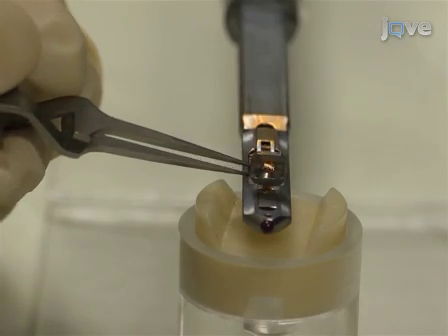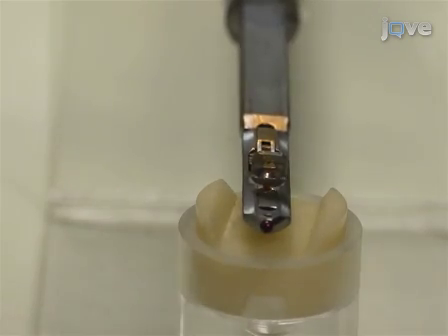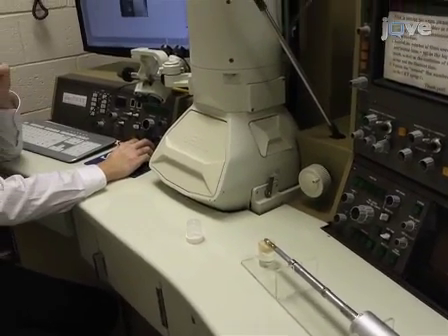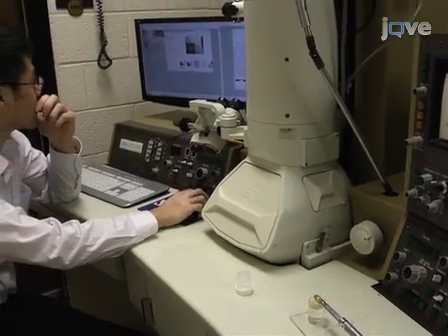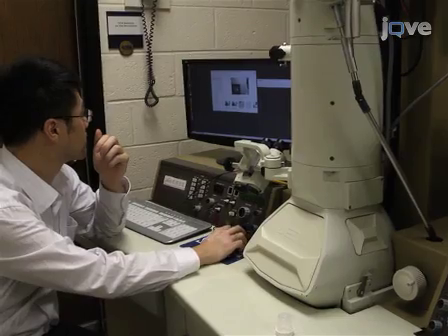Observe the morphology of the film using a transmission electron microscope with a voltage of 100 kV after the volatilization of methanol solution. For the position of interest in the sample, the electron diffraction pattern can be obtained with a CCD camera length of 50 cm.